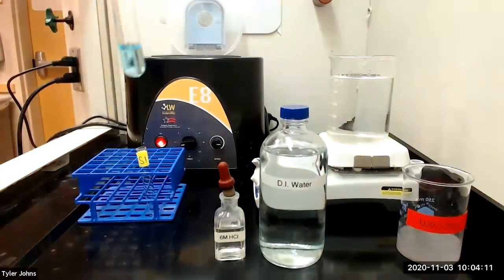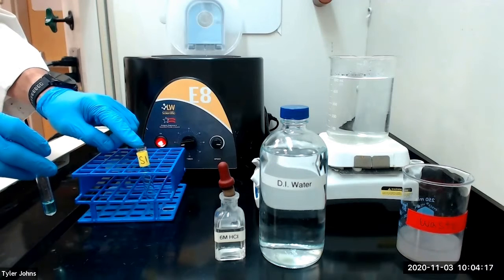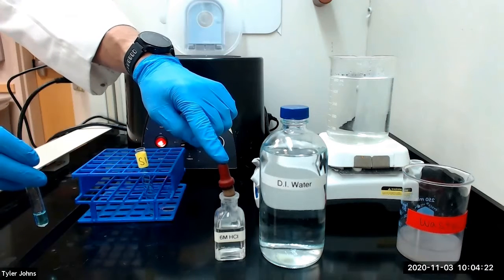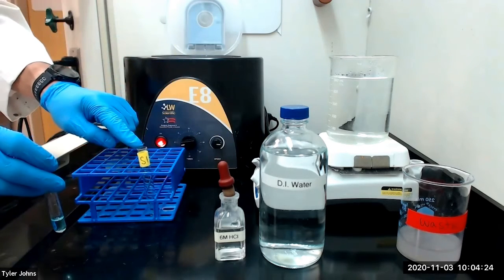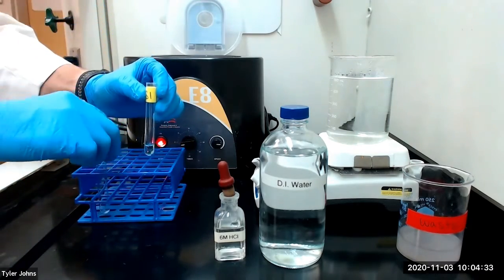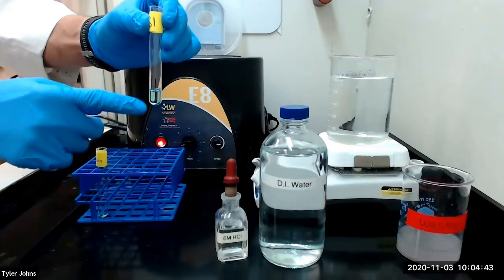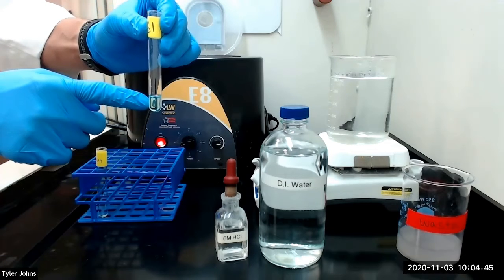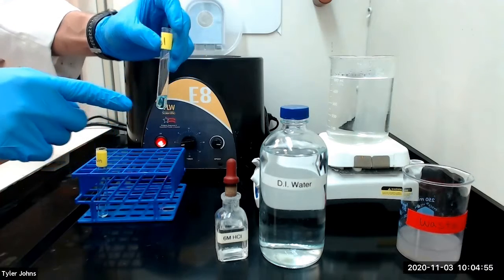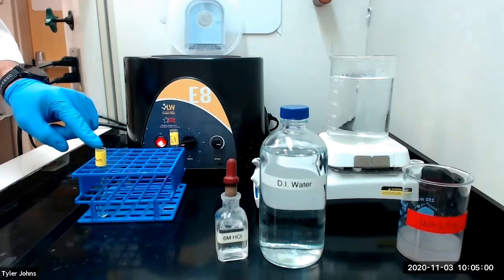We will next decant the solution into a new test tube labeled S1 and then test for completeness of precipitation by adding 1 or 2 more drops of 6 molar hydrochloric acid to solution S1. No more precipitate has formed, so precipitation is complete. We will save solution S1 for later analysis. And we will relabel our residue as residue R1.